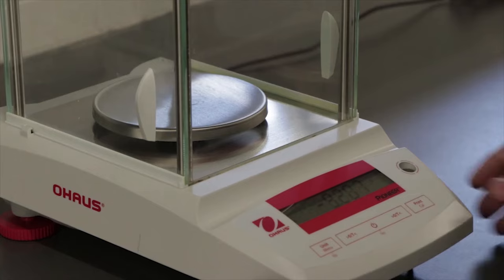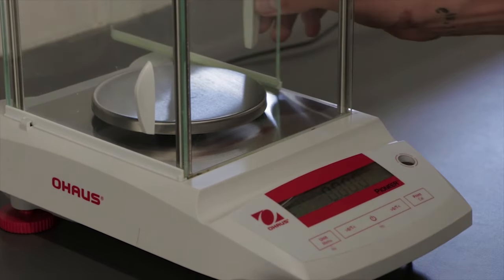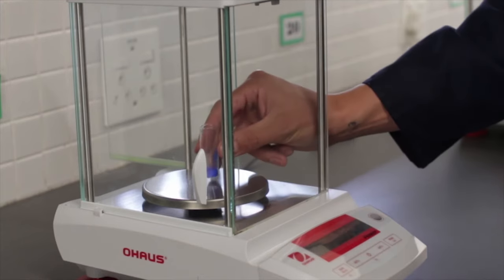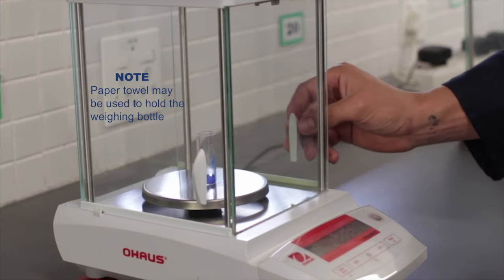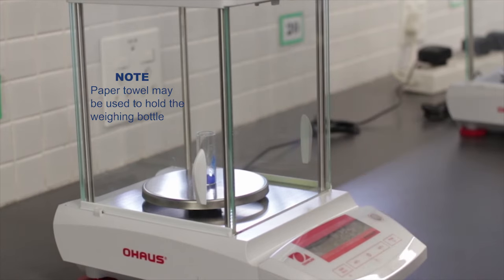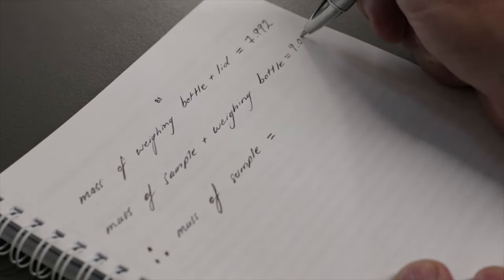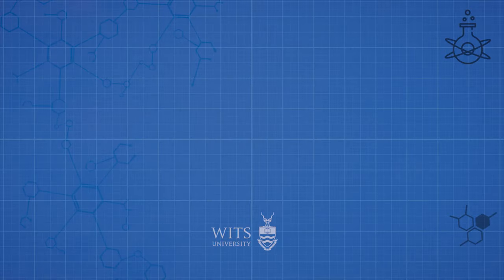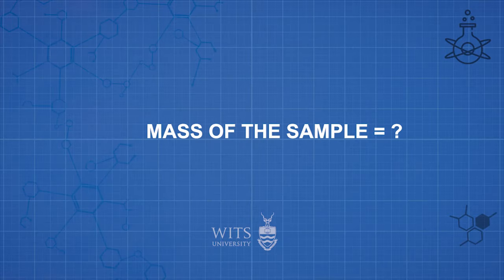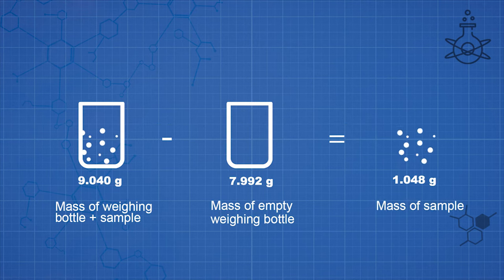Step 5. Go back to the accurate balance room. Zero the balance if the reading on the display is not 0.000, and place the weighing bottle with the sample on the balance. Record the mass of the weighing bottle and its contents. Remember to record to all decimal places shown on the balance, even if the last digit is 0. To determine the mass of the sample that was added to the weighing bottle, simply subtract the mass of the empty weighing bottle from the mass of the weighing bottle with its contents.